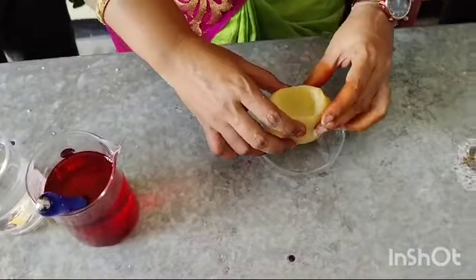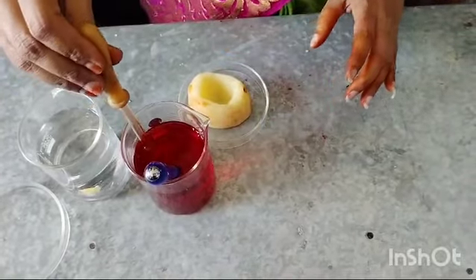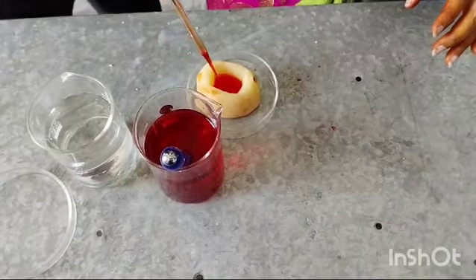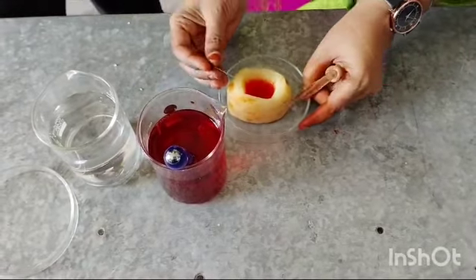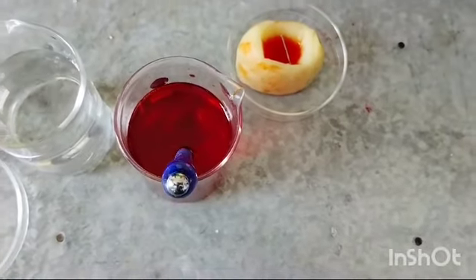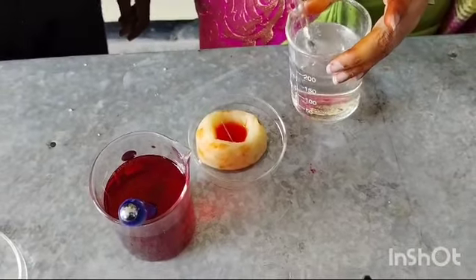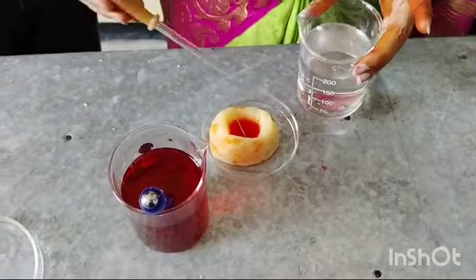Now take one potato cup and drop some saturated sugar solution into the potato cup. Place a ball pin up to the water level. Add some water into the petri dish up to half of the potato cup.